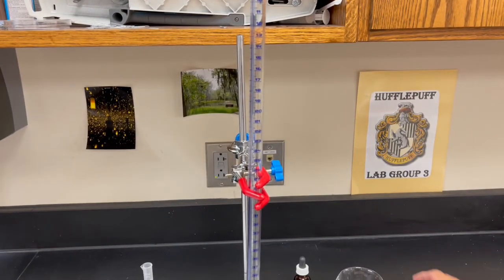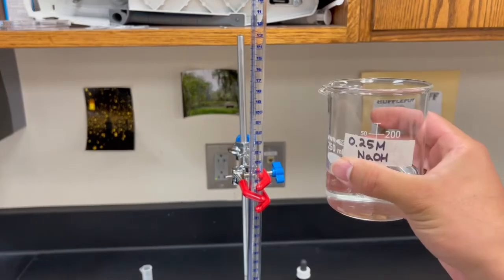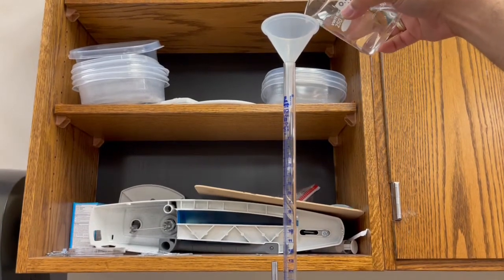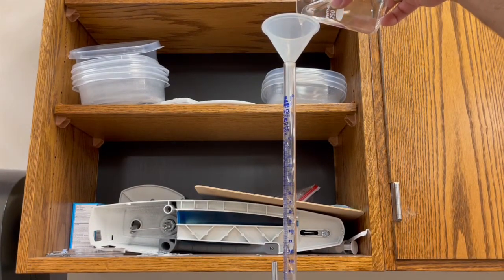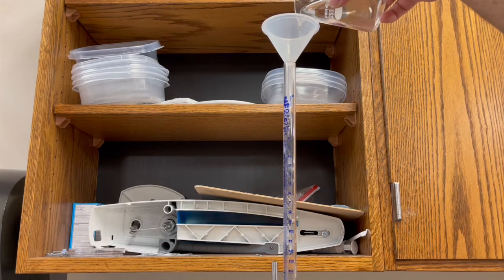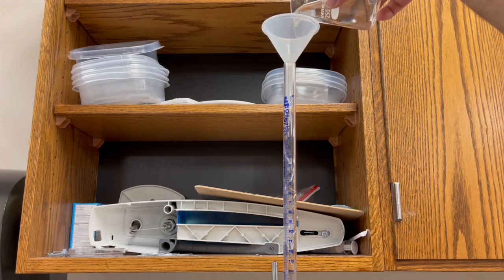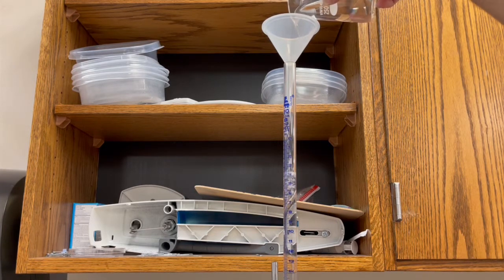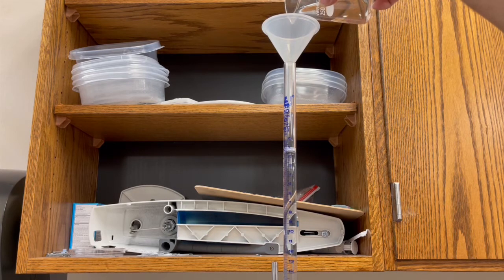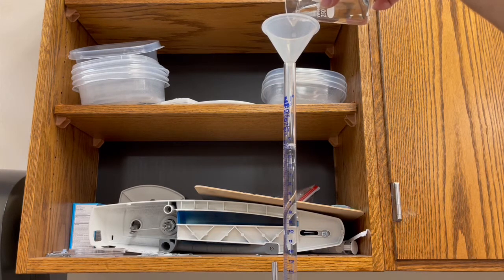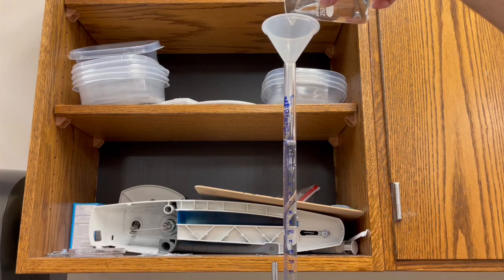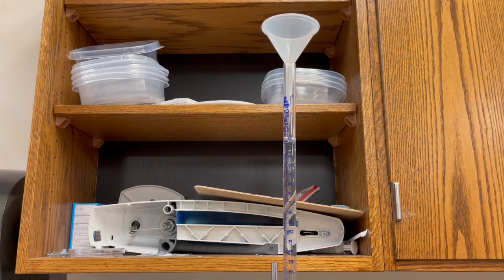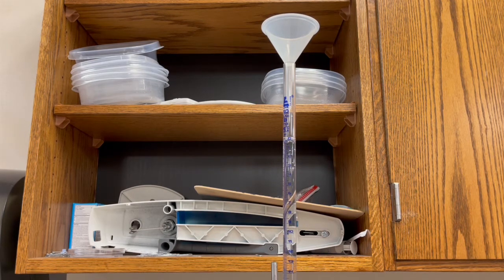Now, it's time to add my sodium hydroxide. So I'm going to carefully pour it in and fill it up all the way to the top. Very close. And there it is. At zero.